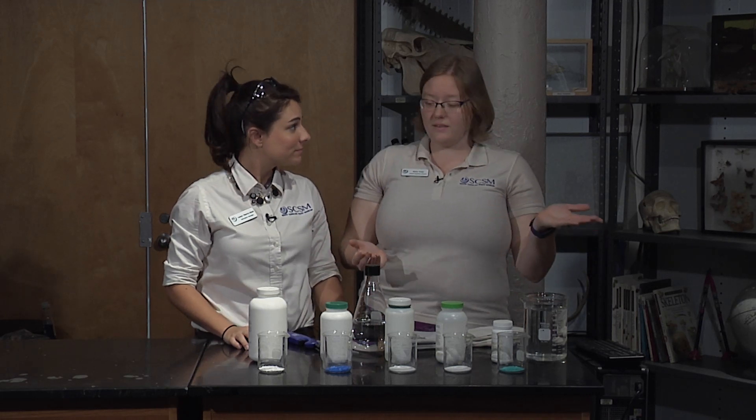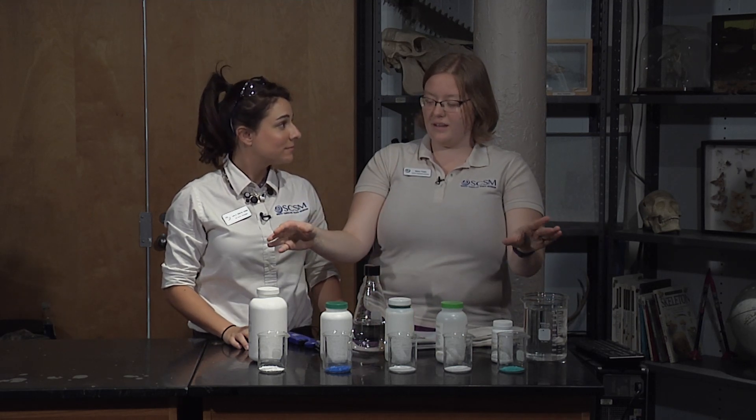So what do we have here? Alright, so we're going to be looking at some properties of the different compounds like Miss Laura said. We have a few different salts on our table.